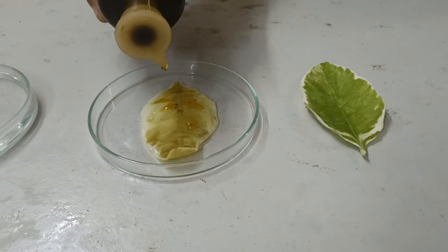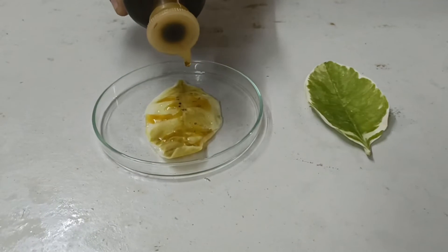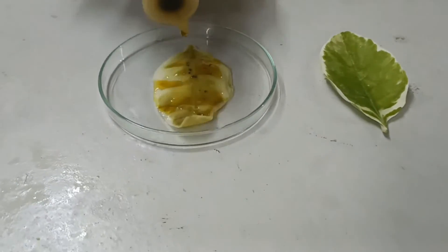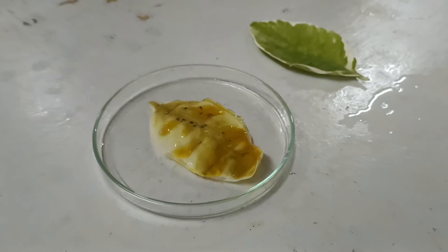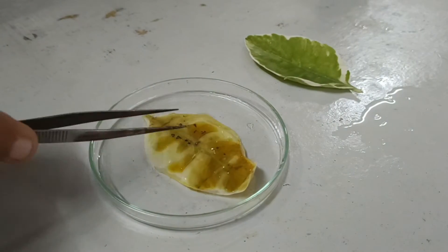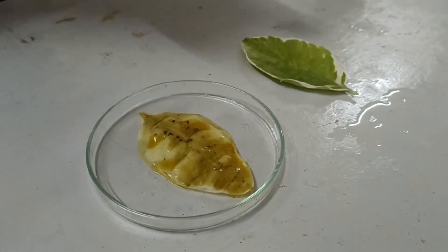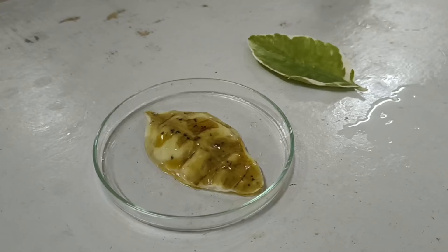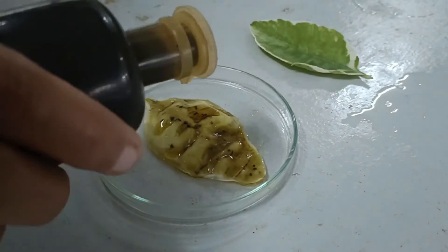Please note the change in color of the leaf in different areas to blue-black. This is due to the presence of starch in different areas of the leaf. The blue-black color indicates the presence of starch and also confirms the presence of chlorophyll in those areas. You can very well see that the entire leaf doesn't turn blue-black because of the variegated nature of the leaves.